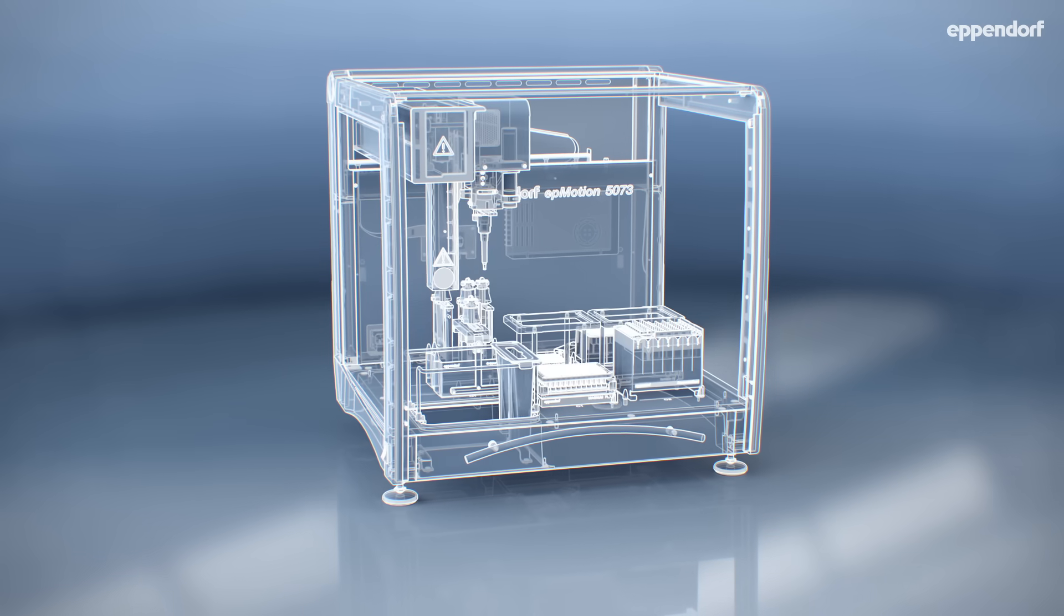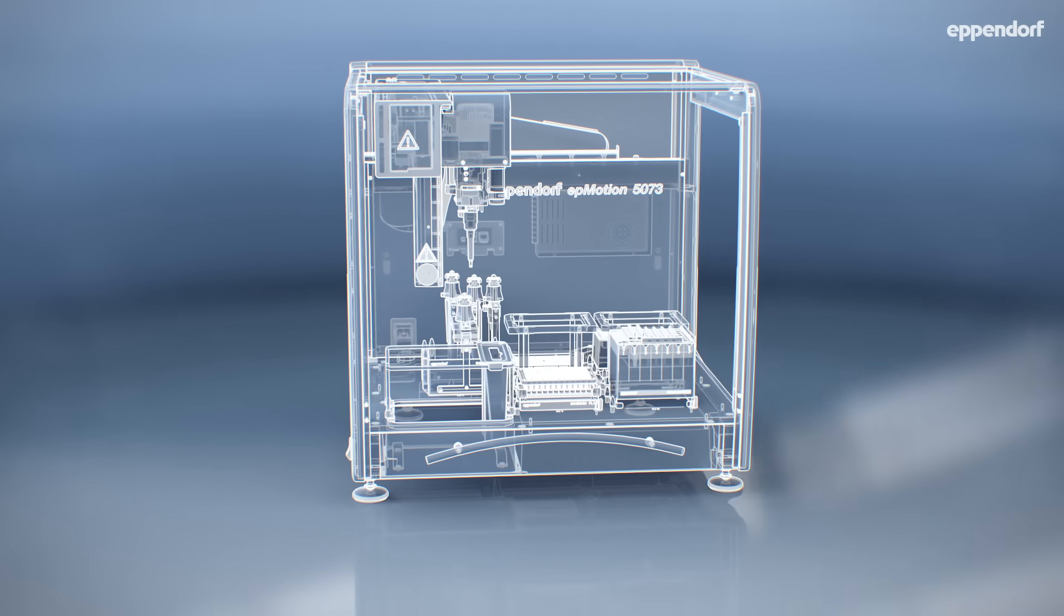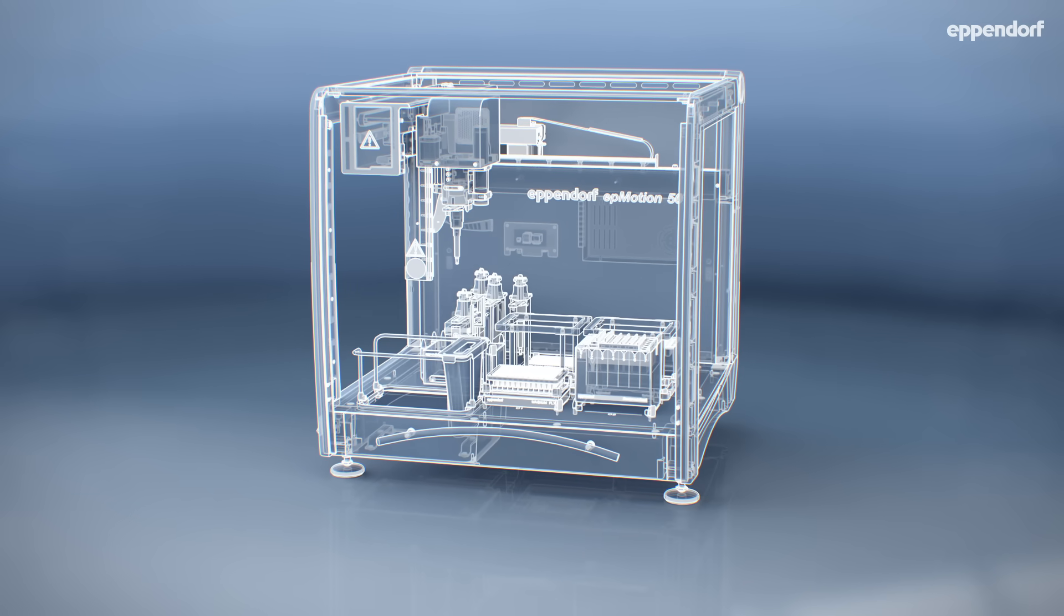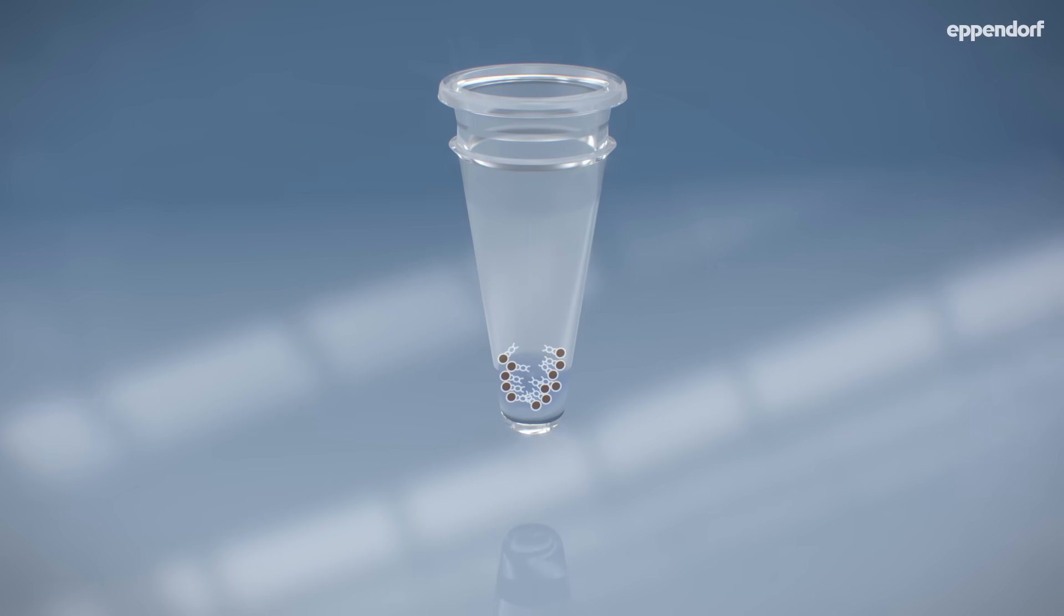Alright, we already managed to get pretty far. Well, the EP Motion did the job. Let's move on to the drying step. Okay, now we take a closer look at this step. It is not as trivial as it might sound.